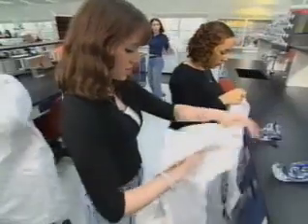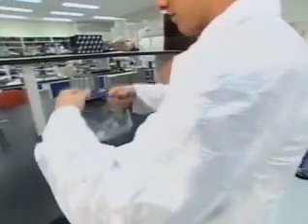And Adam, if there's one thing that you and I both know, it's that once these kids enter the Chem Lab, anything can happen. That's right, Mia. Anything at all, from slips and spills to falls and fires. But it doesn't have to be that way. And that's why this pregame time is my favorite part of the event.